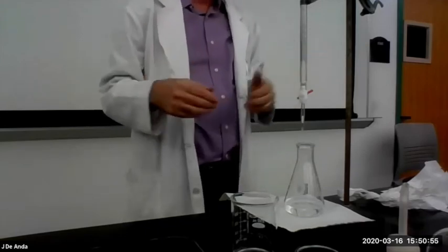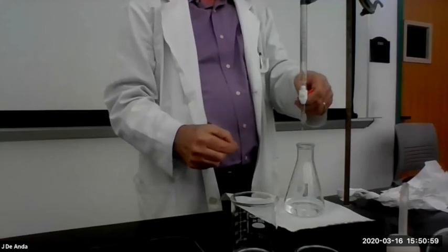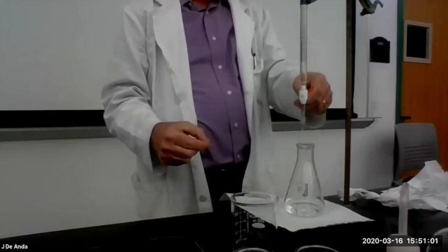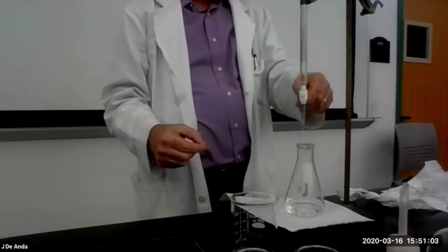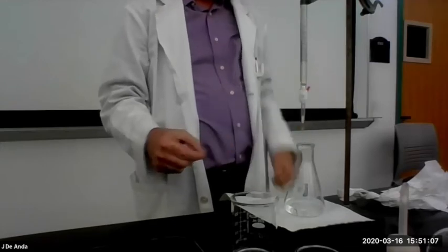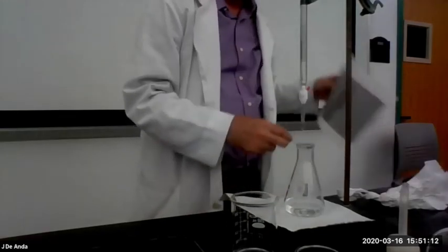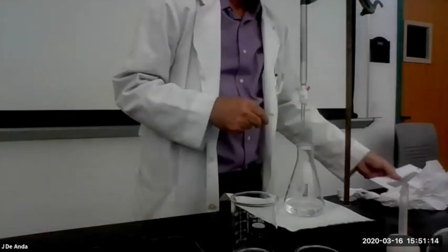The way you do it, you start with a slow dripping kind of delivery. So I'm going to start by opening it slightly here and letting my titrant fall down drop by drop. As it drips down, okay, I don't know if people can see it here on the picture. Oops, sorry, wrong one. Let's put a piece of paper here.